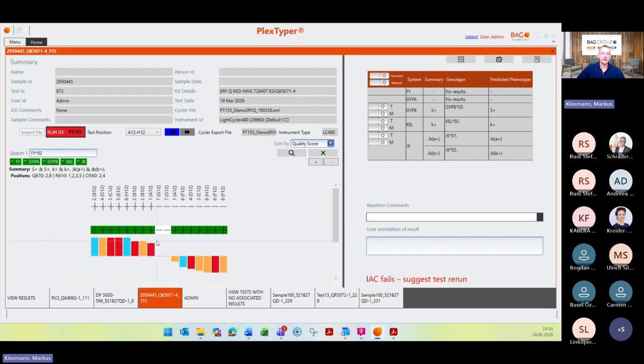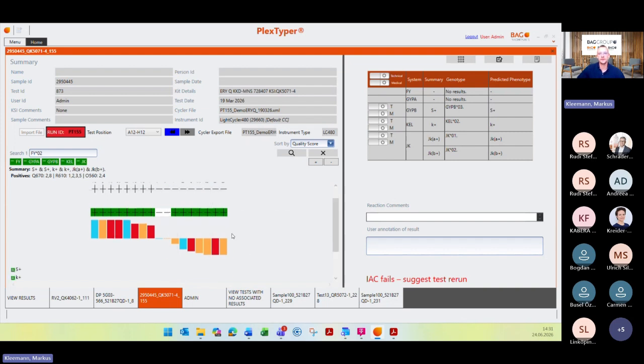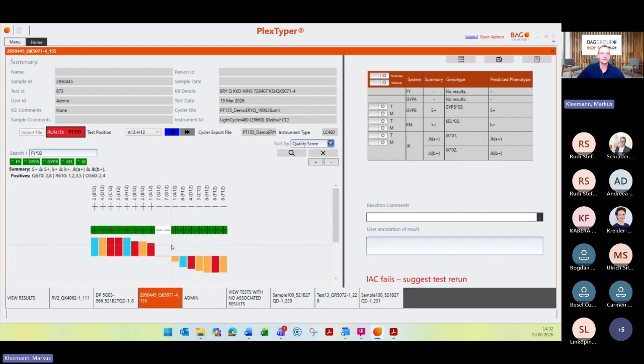And that's why here in this case, probably the sample was not pipetted in this well here. Maybe it went further on in this well after this one here. And that is an indication that you have to repeat your test, because you also got this remark here that the internal control failed.